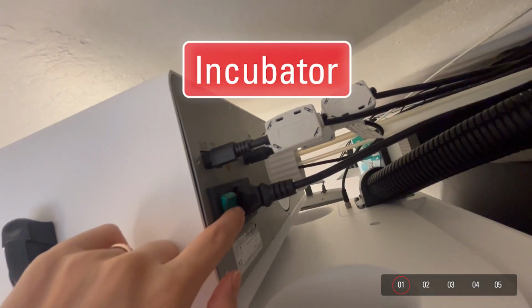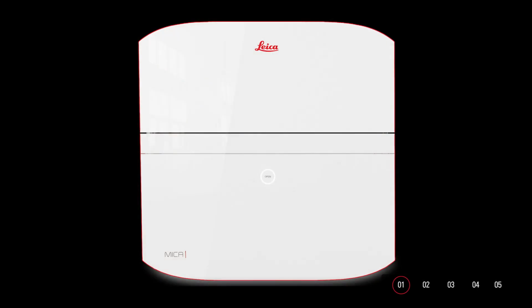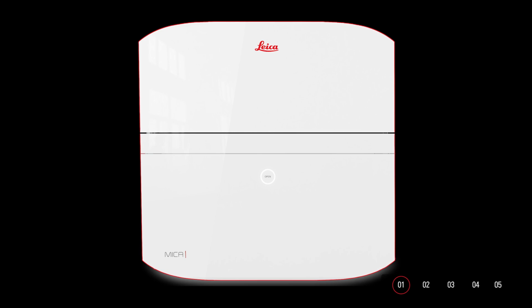If you're imaging live cells, please turn on the power of the incubator before opening the software. While the incubator is warming up, the Open touch button on Mica will light up in red. When the conditions have reached equilibrium, the Open button will turn white.